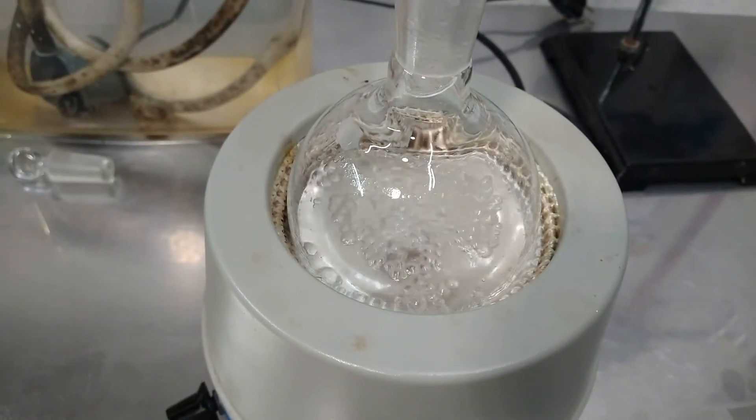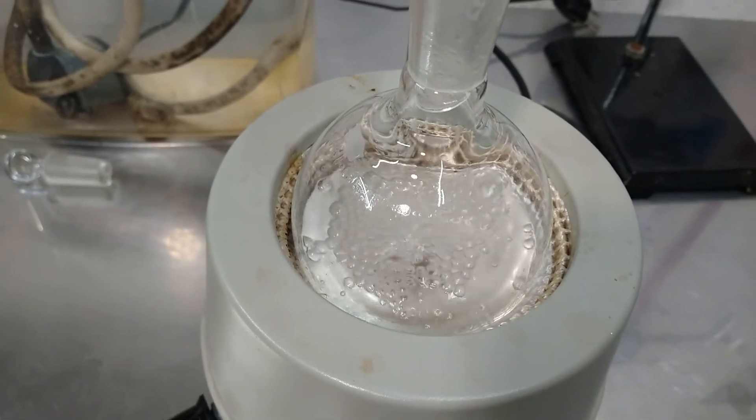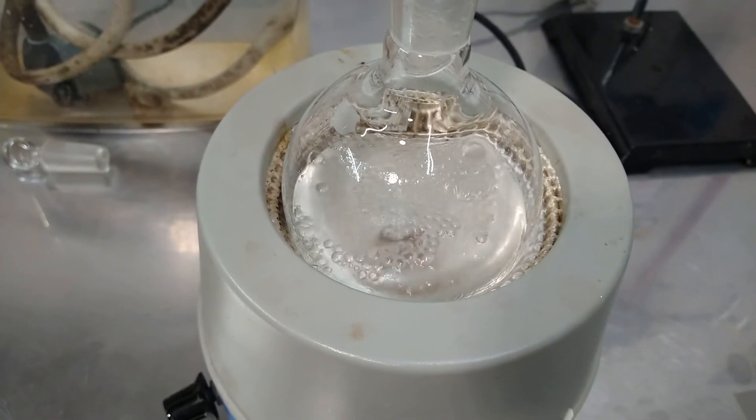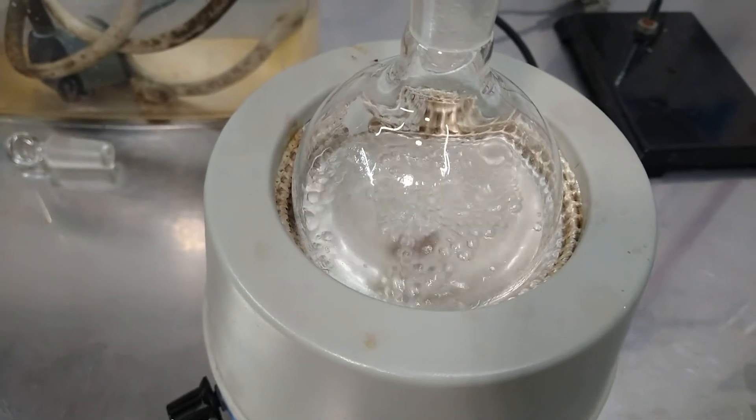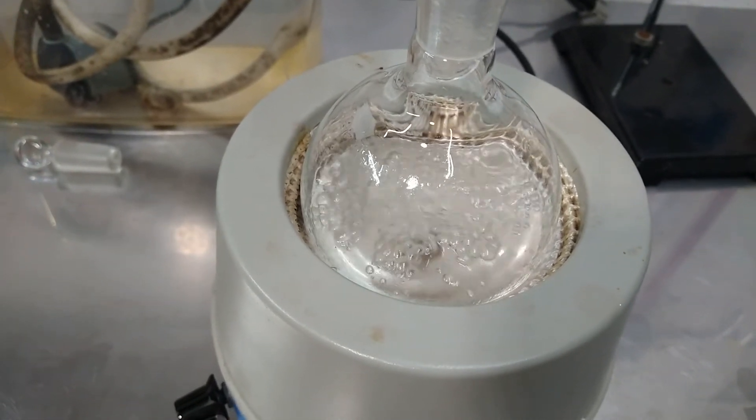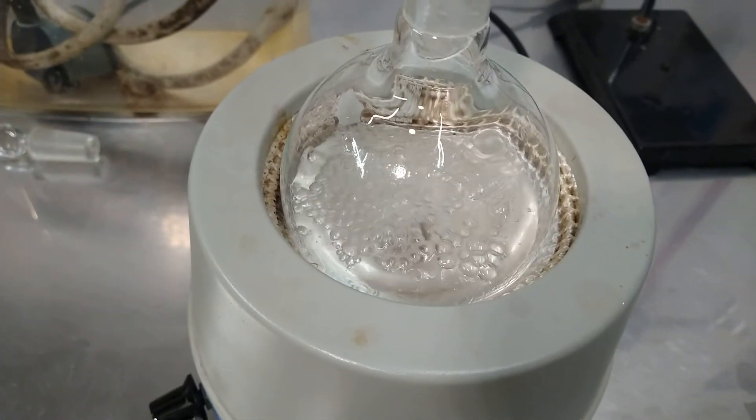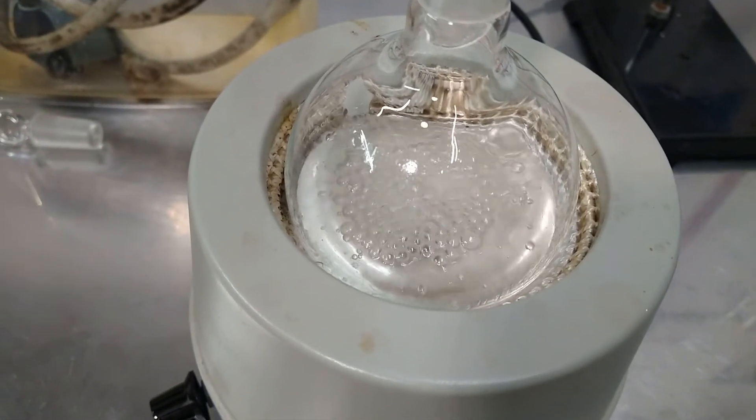So this is how the reaction looks after 7 hours, 7.5 hours. As you can see the reaction is very tame now, the boiling has almost ceased and we can proceed to cool down the mixture and filtrate to eliminate those boiling chips.